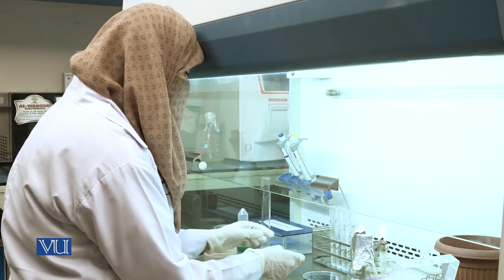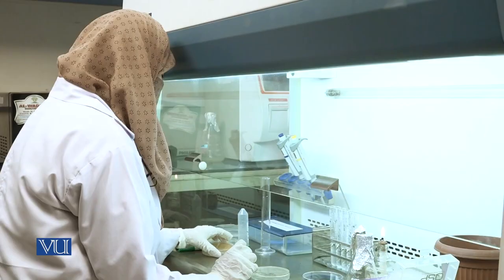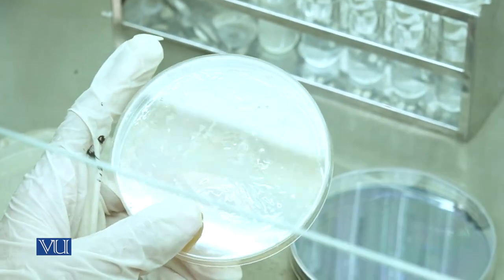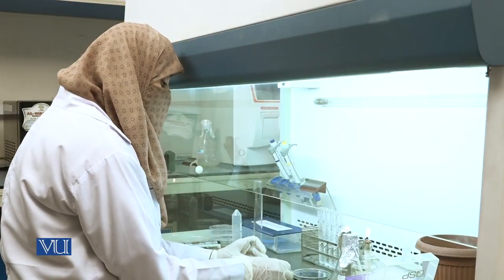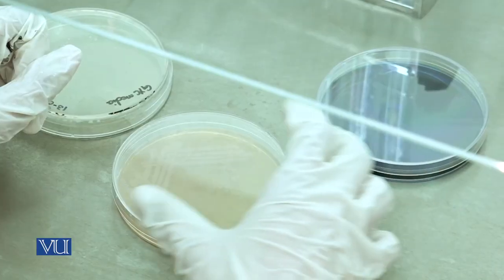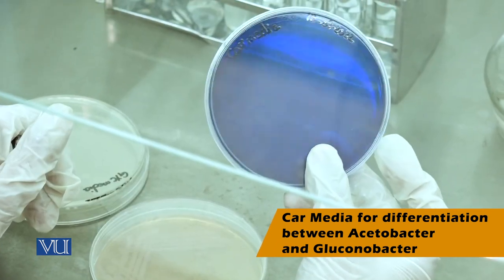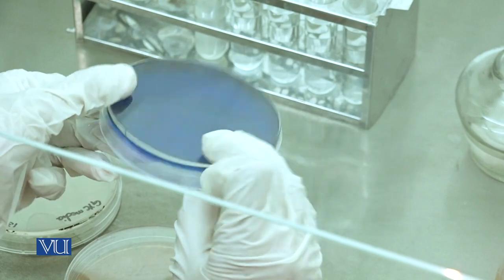Place the plate in the incubator at 30 degrees centigrade for 7 days. This is the Acetobacter growth on GYC media. For differentiation of Acetobacter and Gluconobacter, we prepared another media known as CAR media. This is the already prepared agar plate.